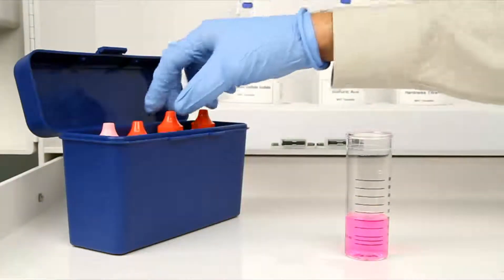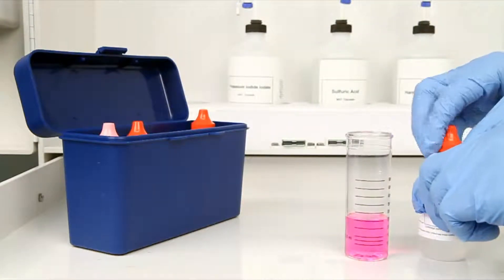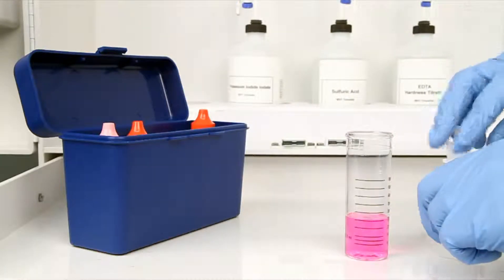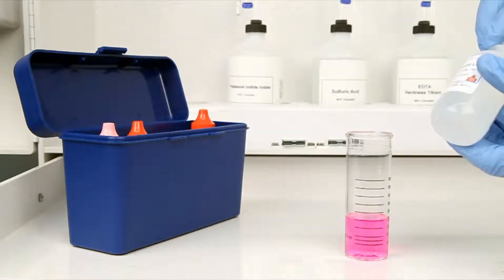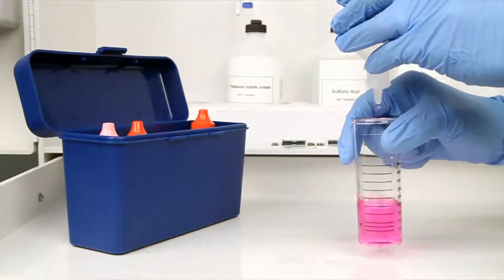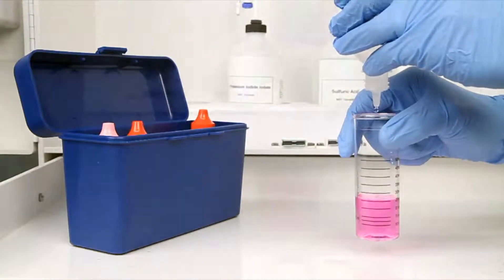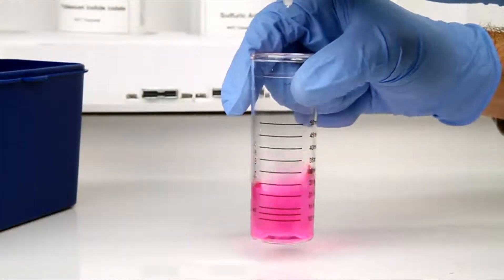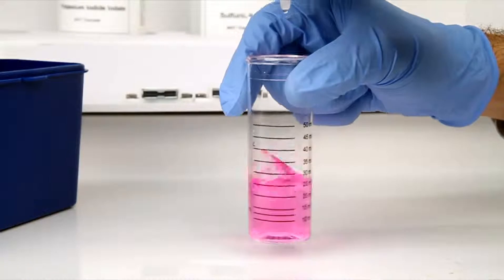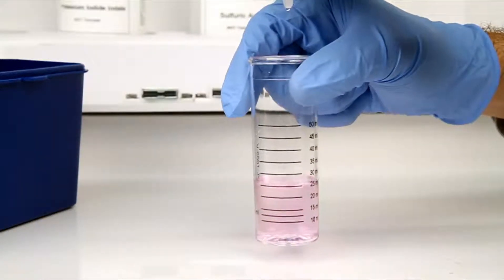The next step according to the endpoint ID procedure is to perform the titration. The bottle of titrant contains a dropper tip, therefore it's important to hold the bottle vertically to make sure you get a consistent drop size. After the addition of each drop of titrant, you want to swirl the vial to make sure the sample is properly mixed. The titration is complete when the sample is changed from pink to colorless.